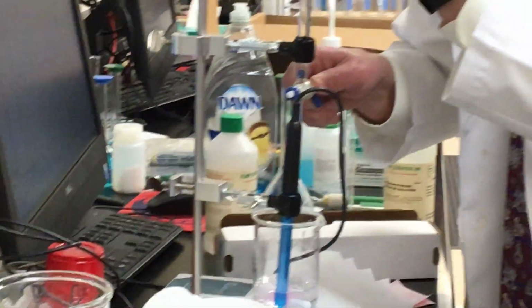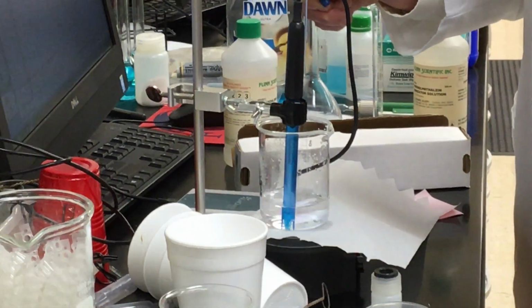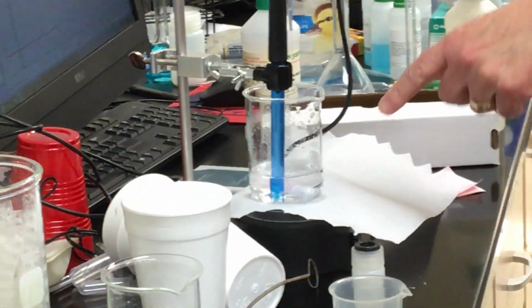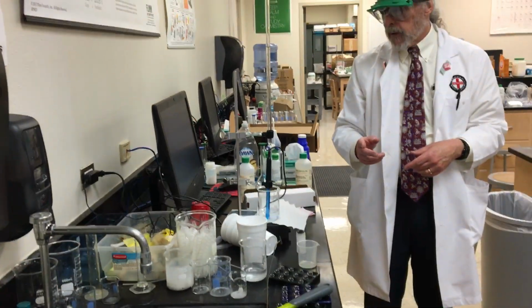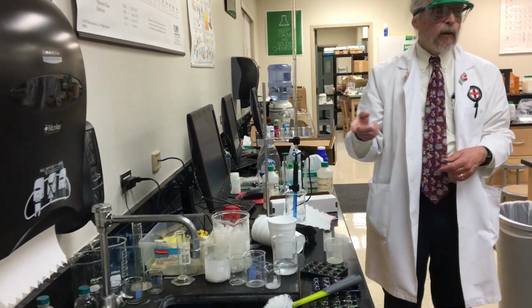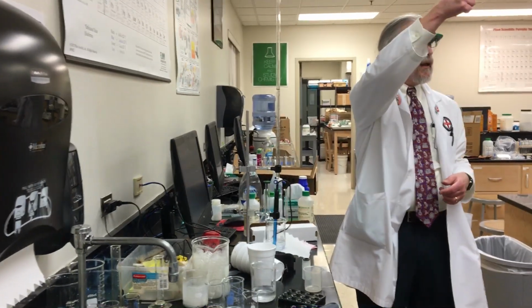If you are not seeing, okay, do you see the little, let me get a drop. Do you see a little bit of a pink color where the drops are hitting? Yeah. So you get a pink, and then when I stop, it fades away because there's still more acid than there is base. When you are doing a titration properly, when you see that happen, that is the system's way of saying you're starting to get close to where this is going to take off.